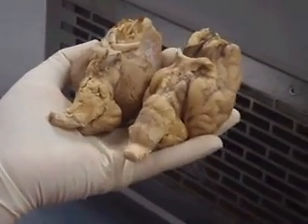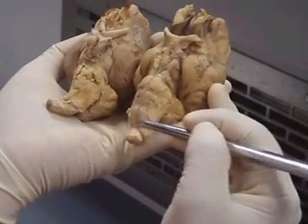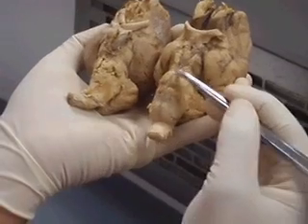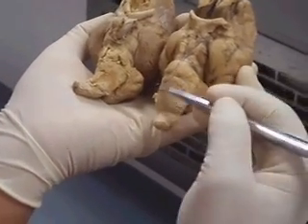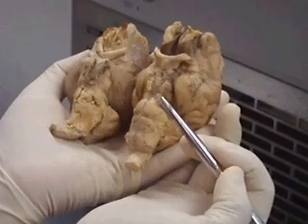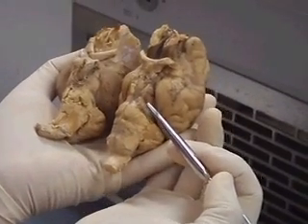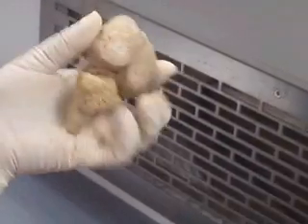The medulla oblongata is the long part of the hindbrain. Pons. Medulla oblongata. Next, we see the remaining parts of the brain in the sagittal section — something that can actually open.